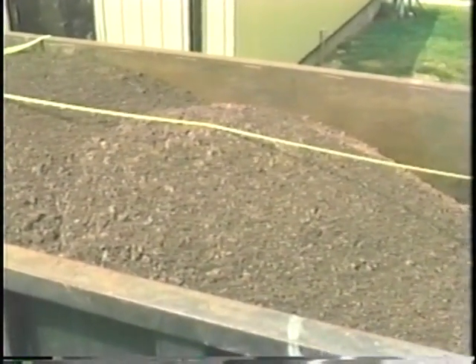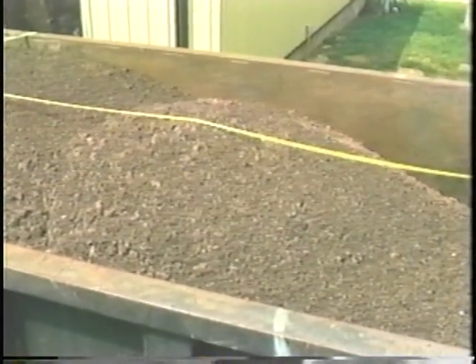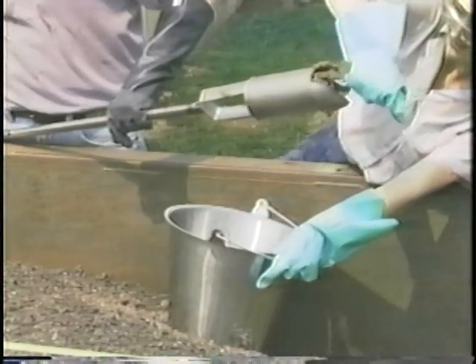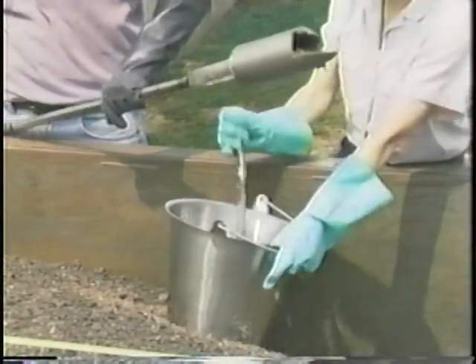4 quadrants in the bin, using a scoop if the bin or drying bed is shallow, or a coring device that allows you to collect a sample the full depth of the sludge. These samples should be combined, forming a sample that is representative of the entire contents of the bin.